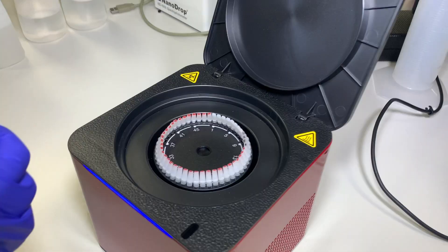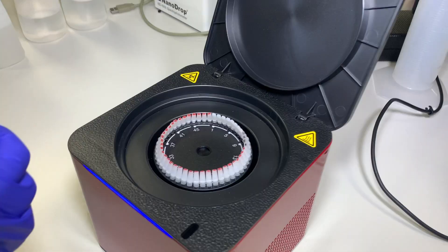When finished, all positions must be filled with tubes. Replace the magnetic clamp and close the lid.